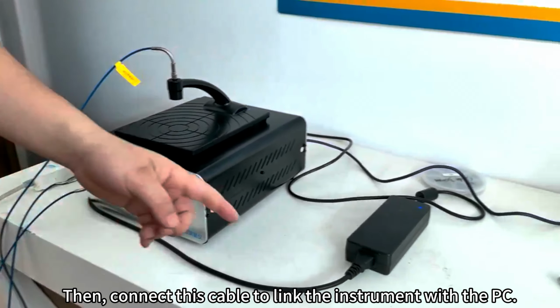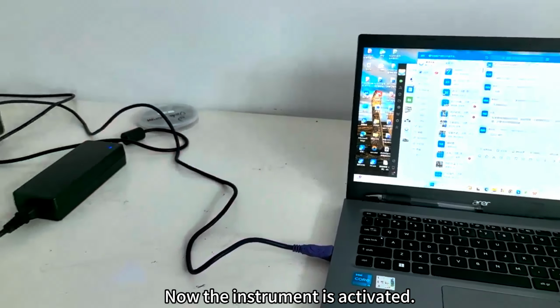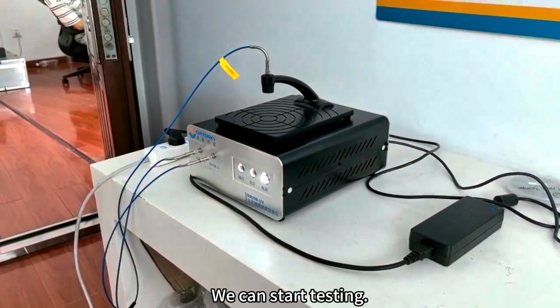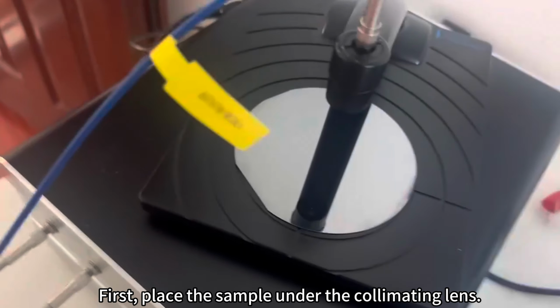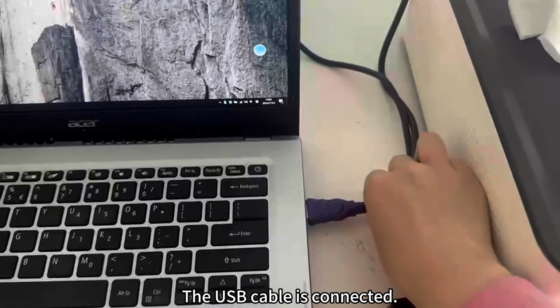Then connect this cable to link the instrument with the PC. Now the instrument is activated. We can start testing. First, place the sample under the collimating lens. The USB cable is connected.